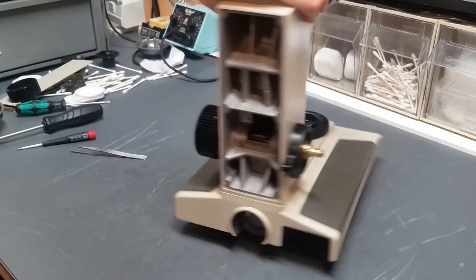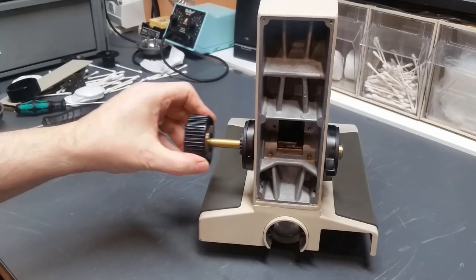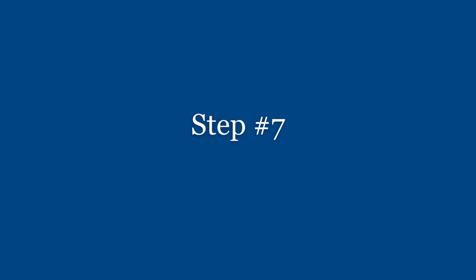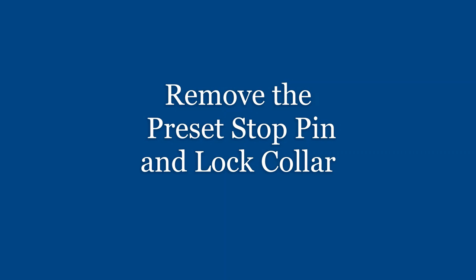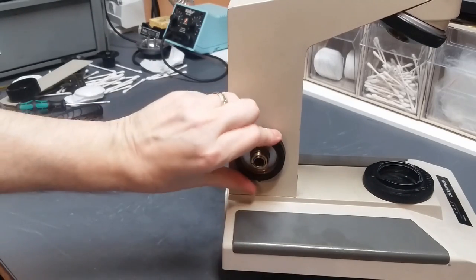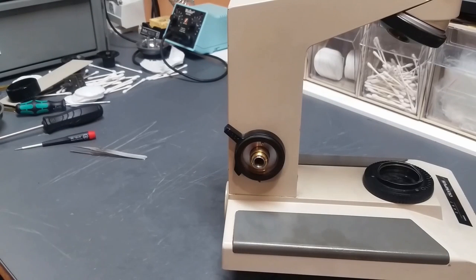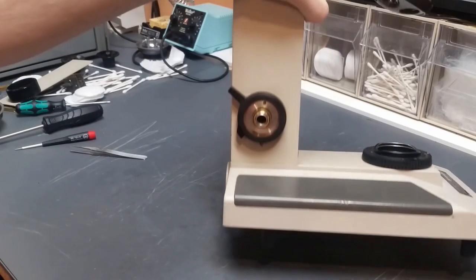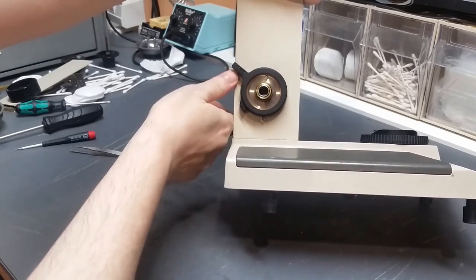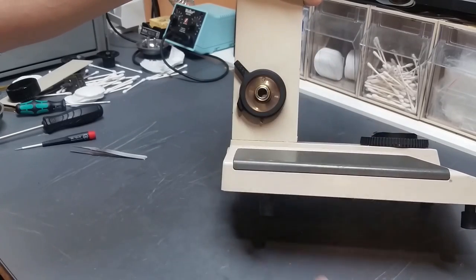Okay, the next step is to just remove this coarse focus knob with all the gears intact and this shaft. This should all come out just as a unit. Basically, just pull that out and we'll clean all that up on reassembly. And at this point, what we would like to do is remove this focus lock collar. And in order to do that, there is a slotted stop screw here that this piece of the plastic comes into contact to prevent this thing from rotating too far. So we have to take that out.